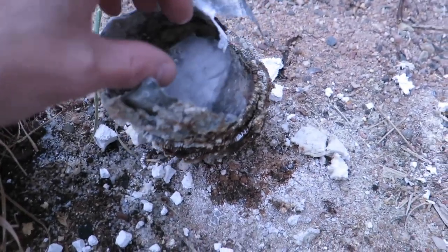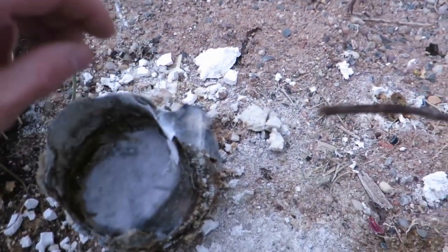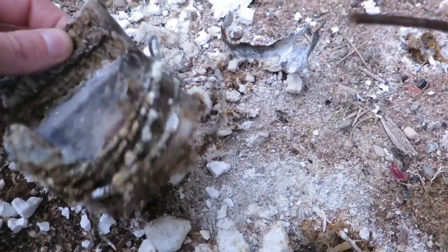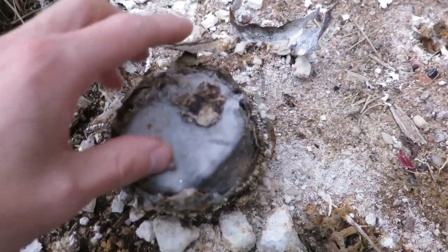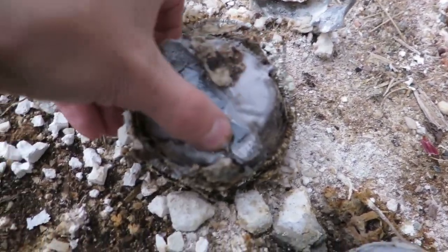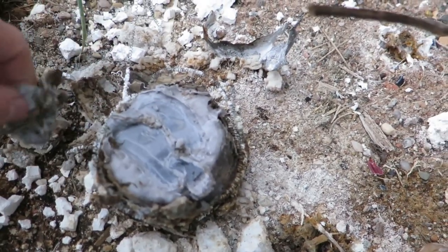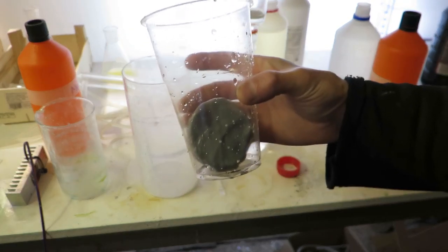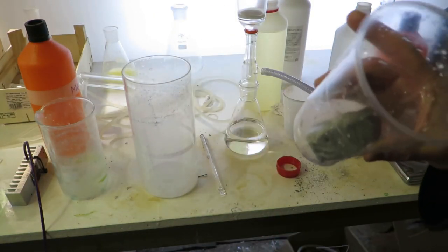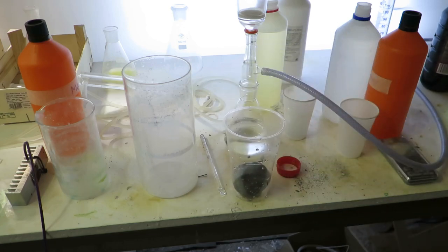Okay, so here you can see blob. It's just relaxing here, converting itself to carbonate. So I will hit this, clean it up a little bit and dissolve. Yeah, it's pretty untouched down there. So let's do that. Anyway, here's the hydroxide. I will have to clean it a little bit more still, because there's some junk. But it will be fine for analysis.